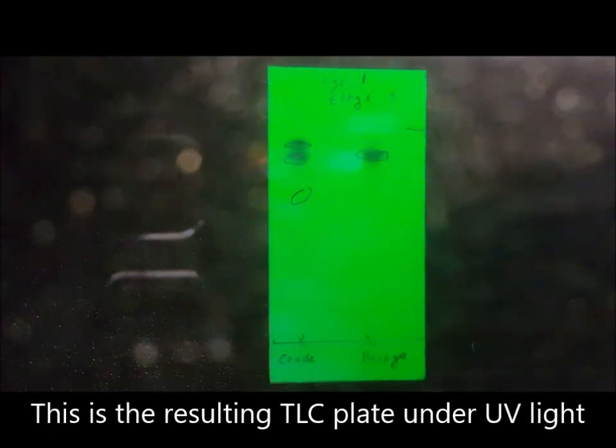Analyze the purity of your impure product and your recrystallized product using TLC. First, prepare a sample of the products by placing a very small amount, a tip of a spatula, in a glass vial and dissolving it with 2 mils of ethyl acetate. And prepare your mobile phase. Your mobile phase for this experiment is cyclohexane 1:3 ethyl acetate. You will need to look under UV light to see your samples.